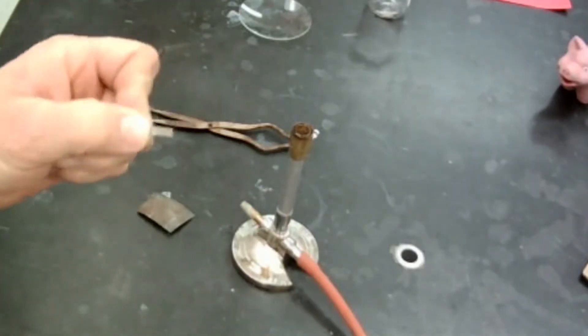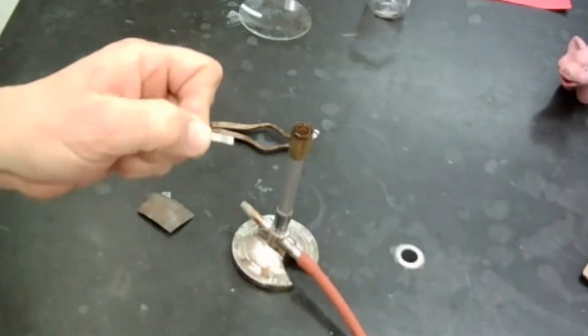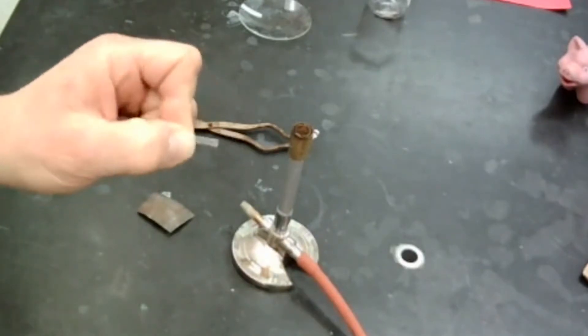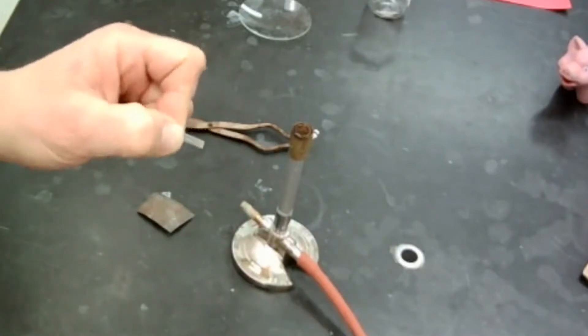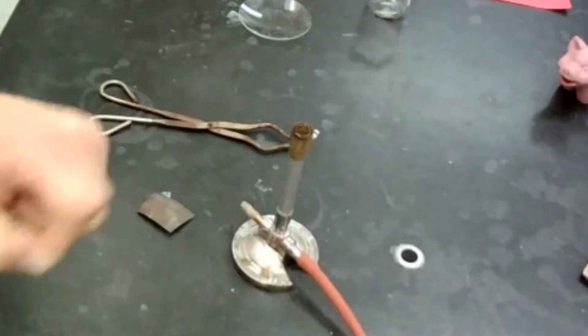And this is shiny. I had to shine it up a little bit because it had an oxide coating on the outside, which is not metal, and therefore it was kind of dull. But now it is definitely shiny. You guys can see how it kind of catches the light as I move it around in the camera here.